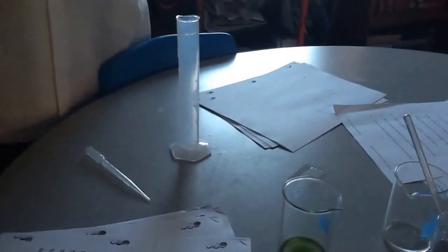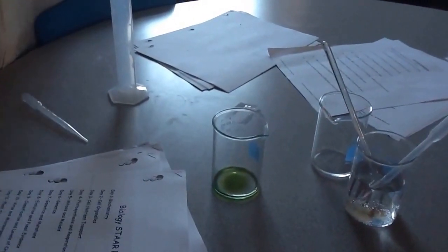Notice that it doesn't really matter what order you do. And this is one of your questions on your test. You could do an acid to a base or a base to an acid. It doesn't really matter.